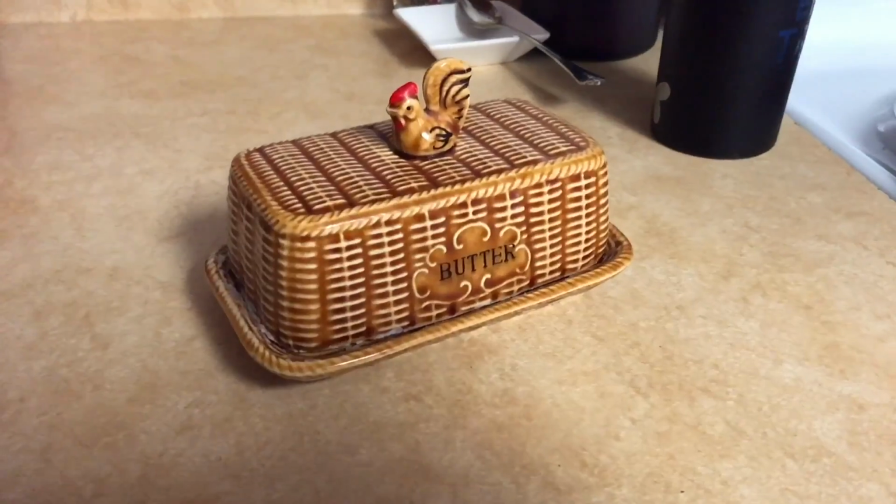So here we are in the chicken kitchen. Today's DIY project is a laser microscope. How cool is that? You just need a few things. You just need a syringe. You need some swamp water, or lake water, or ocean water. Anything like that will do, as long as it's not sterile water. Doesn't work with tap water. Doesn't work with sterile water.